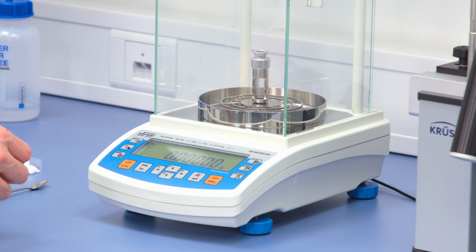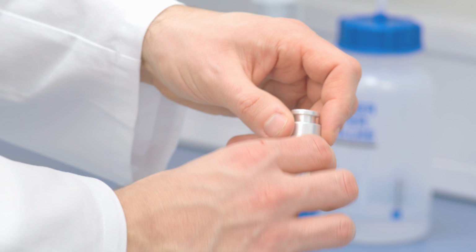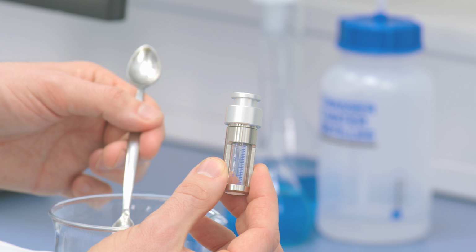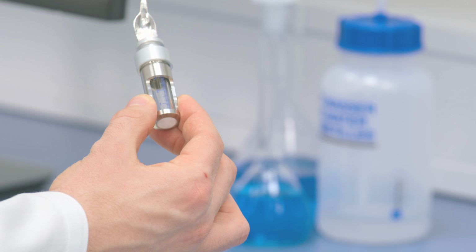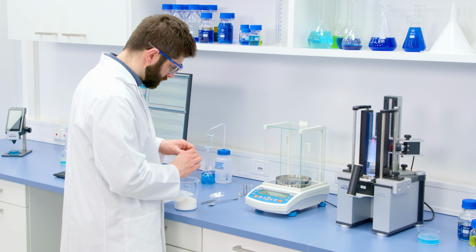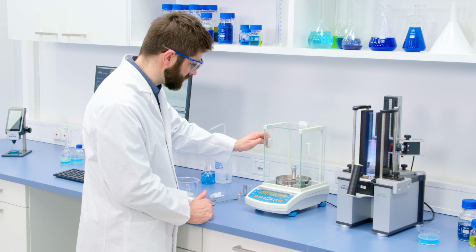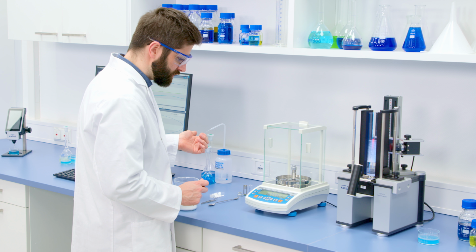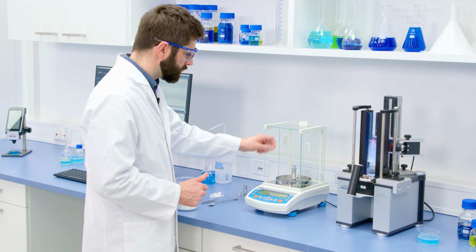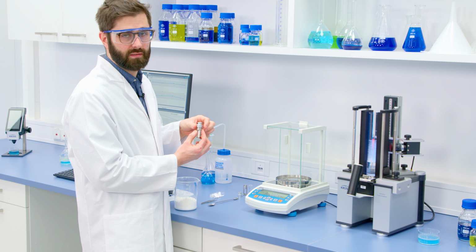And from here I want to now add in my microcrystalline cellulose, and I want to keep an eye on exactly how much I'm adding. The exact amount that I add is not critical, but I need to be reproducible. So let's add a little bit. Okay, that should do it. Put that onto the balance, and I have 0.2206 grams. Okay, now this will be my first sample for determining the C constant value.